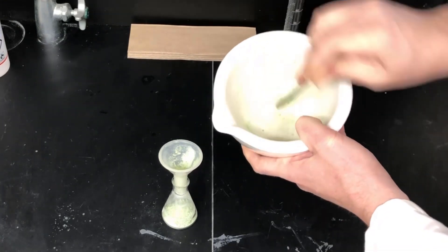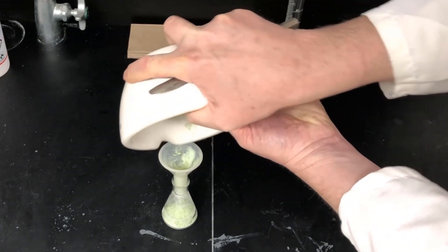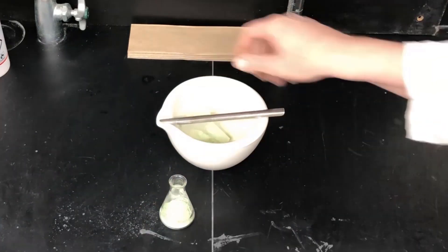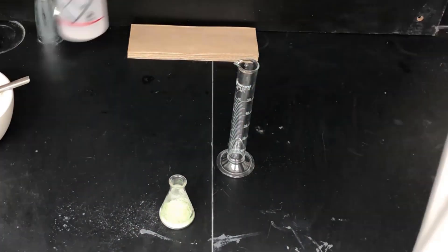There we go. Just clean that up a little bit there. Okay, and now we've got the solid in the Erlenmeyer flask.